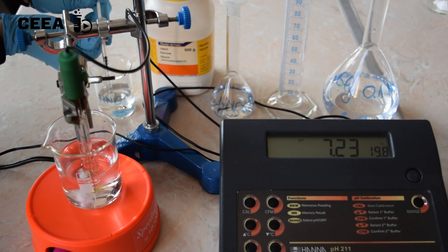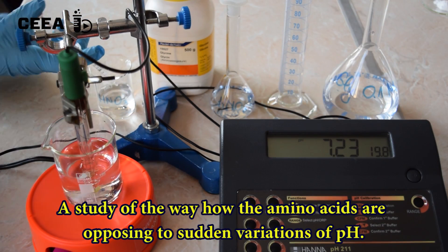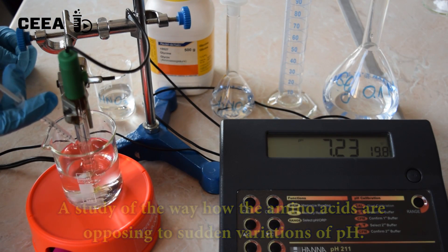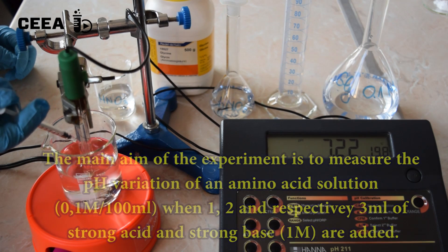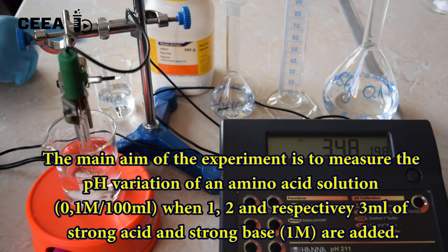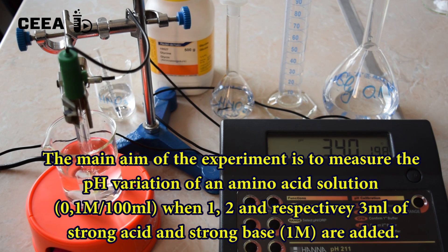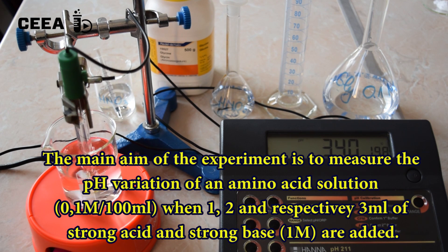A comparison will be made concerning the pH variation when a strong acid or a strong base is added to water, and when these reagents are added to an amino acid solution.